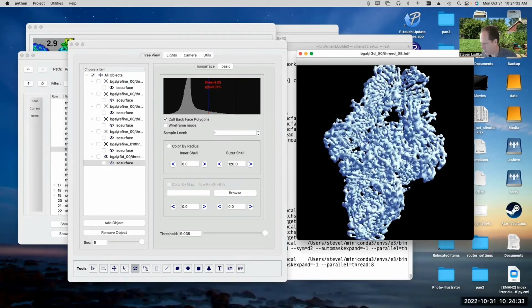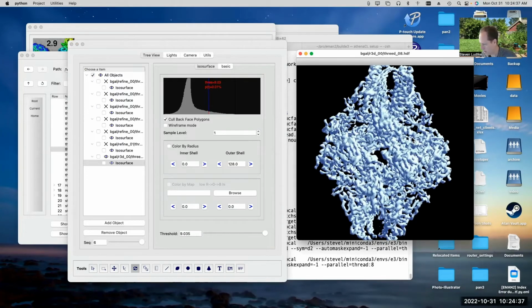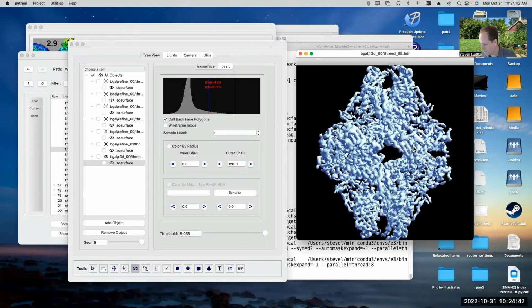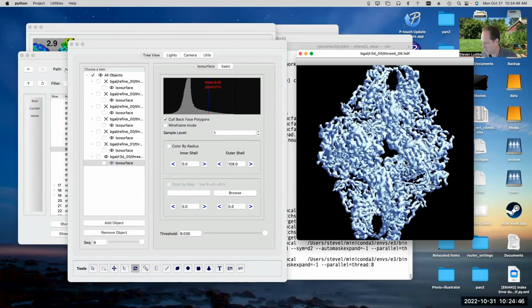Now you can see these beta strands there. They're very nicely resolved. There's a nice alpha helix there. You can see the helix inside. There's another beta sheet in there. As you can see, just visually, it looks a lot cleaner.